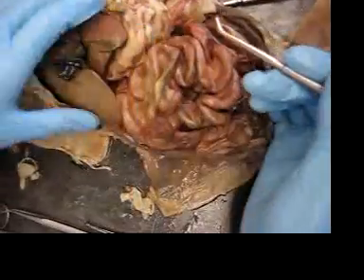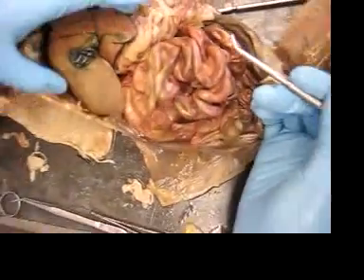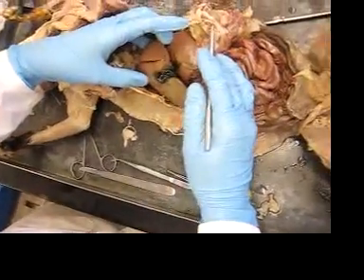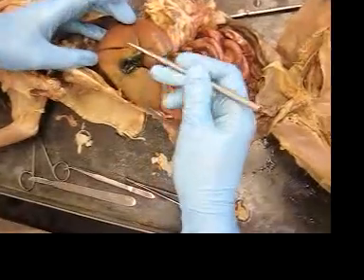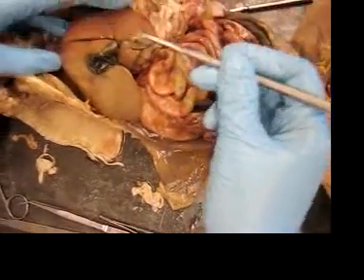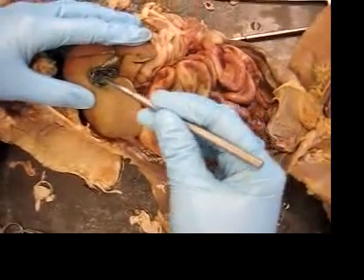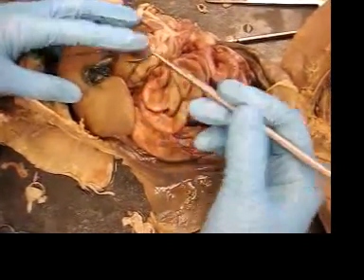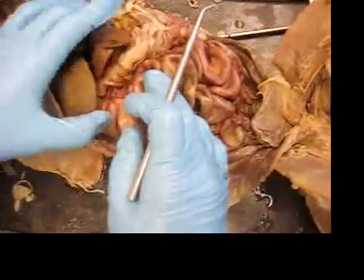We're looking at the digestive system first. This is all liver, and that's the gallbladder right there, and the bile has stained everything green.